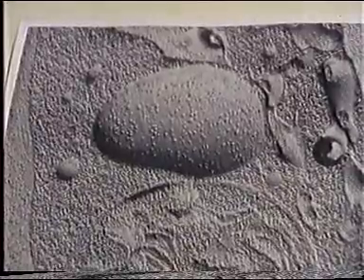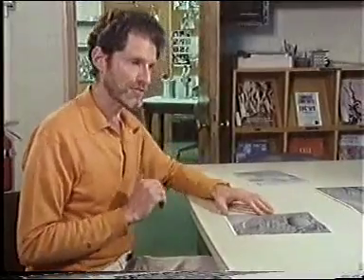with some of the fracture faces exposed. We can see these better on this vesicle. Here, in this vesicle that's protruding from the surrounding cytoplasm, we can see bumps. At first, we didn't understand what those bumps were, nor did we really understand what the fracture faces were.